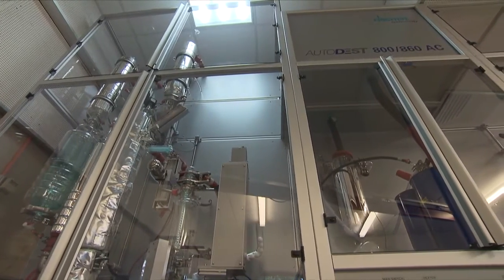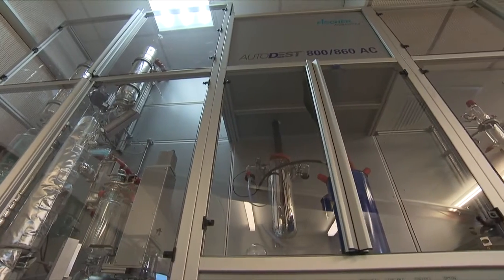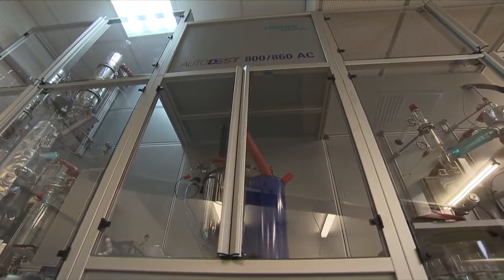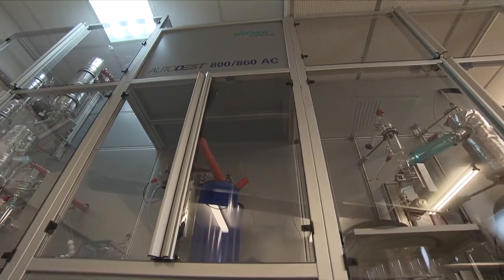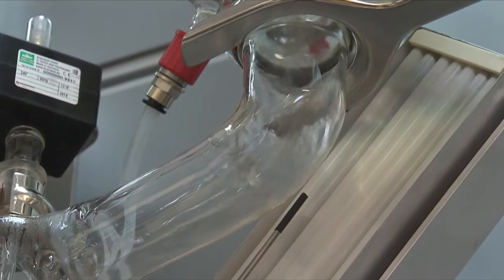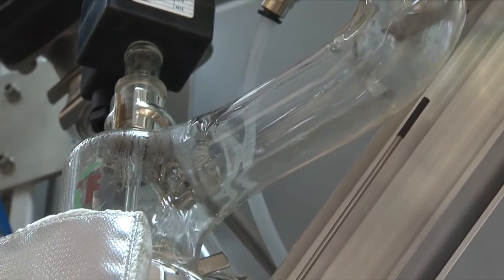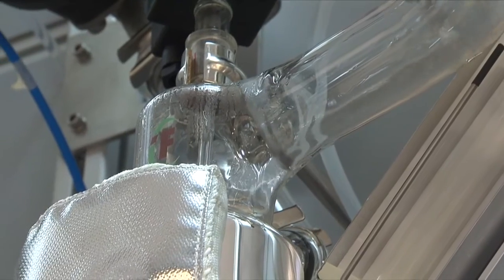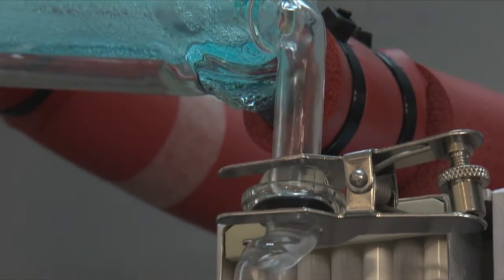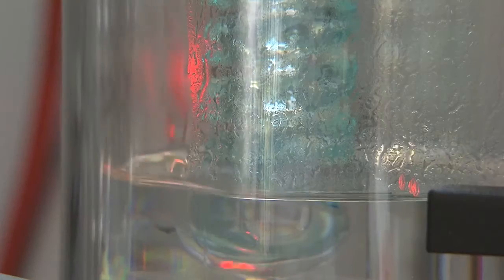Our bigger distillation unit can continue the distillation on the residue product to a maximum temperature of 565 degrees Celsius using test method ASTM D5236. Another key feature of our bigger distillation unit includes a water removal unit. The distillation process will begin under atmospheric pressure starting with a debutanisation step which collects up to C4 hydrocarbons.